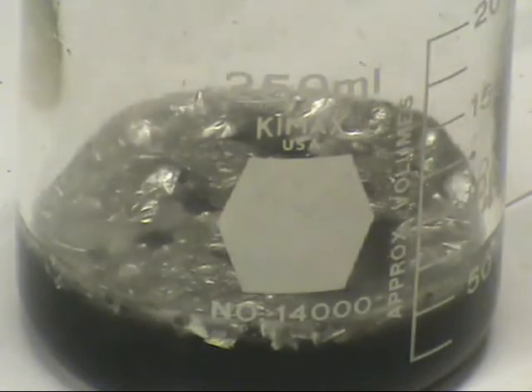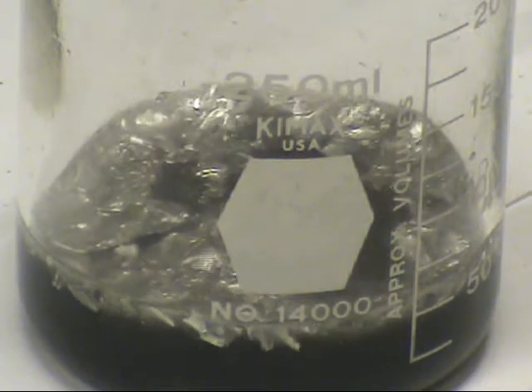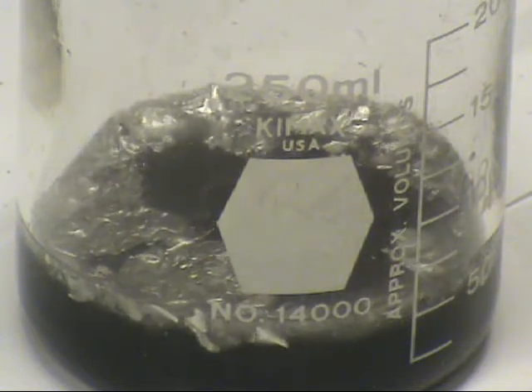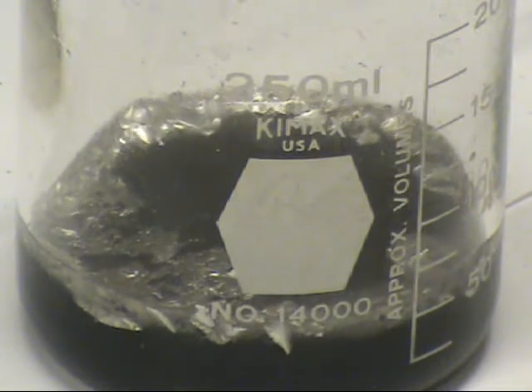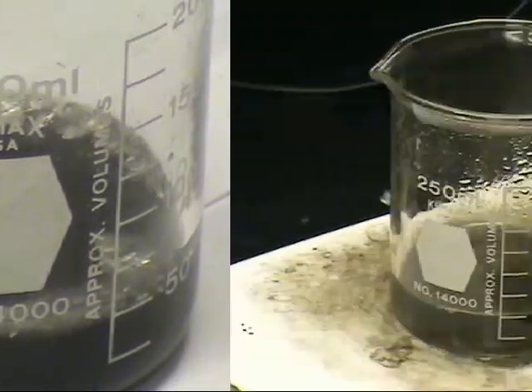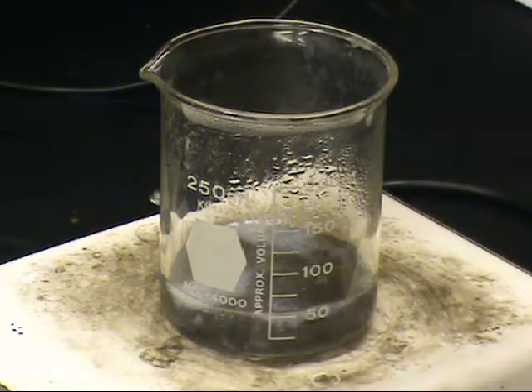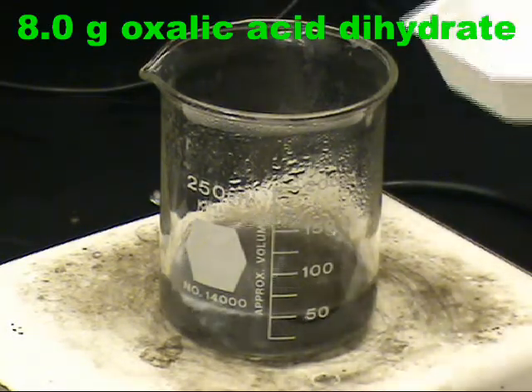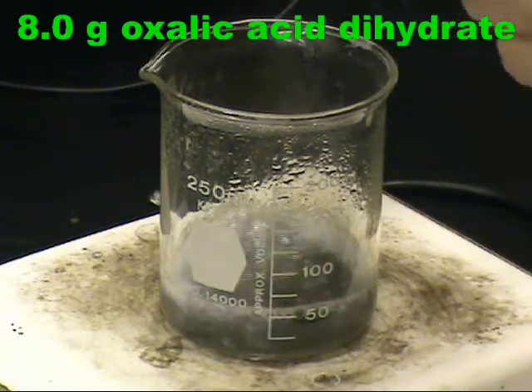Here you see the reaction nearing completion. It will take approximately 15 to 20 minutes for the reaction to get to this point. Next, the solution is transferred to a hot plate and heated to boiling. 8 grams of oxalic acid dihydrate are then added. The solution slowly changes to a clear, pale yellow color.